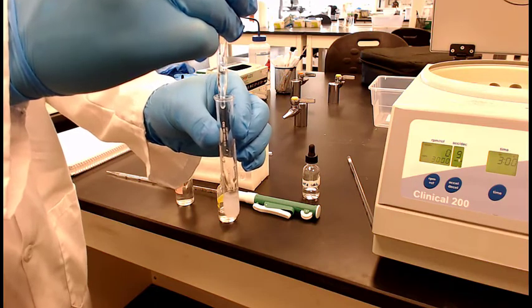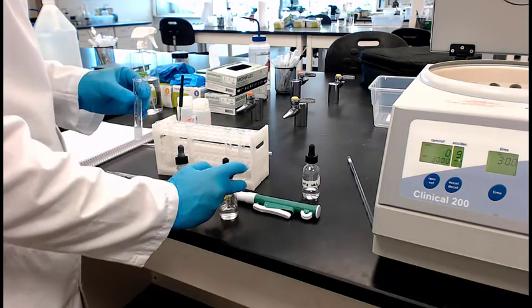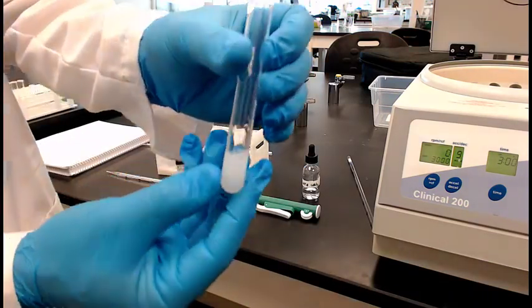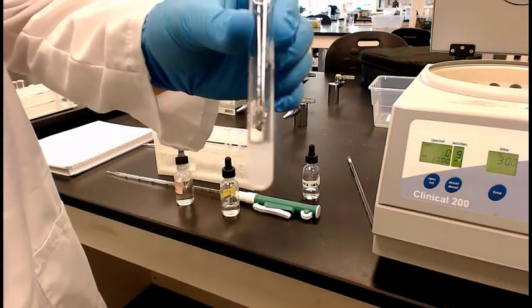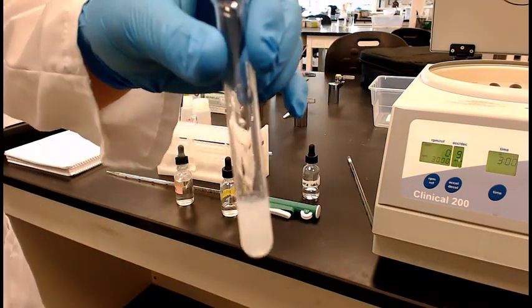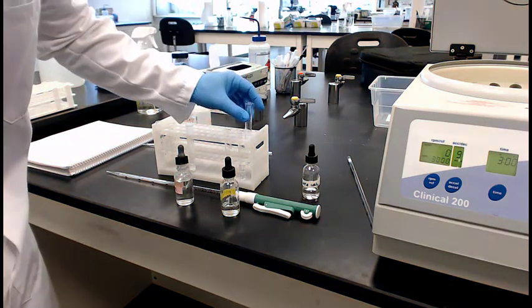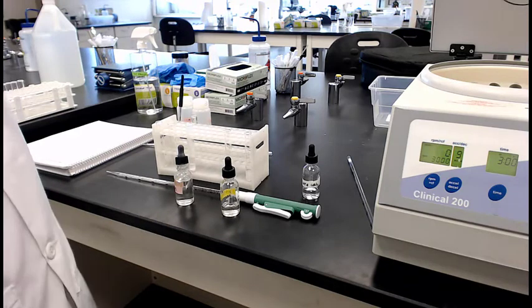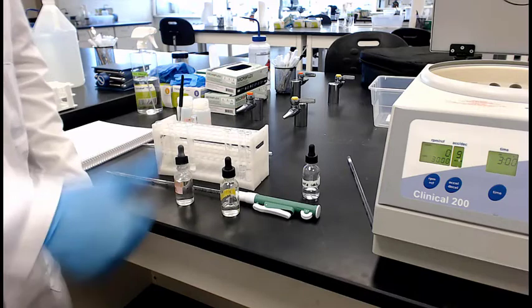Ooh, all right, so that's definitely precipitating up. Get it mixed so we can really see it. Yeah, that's good for you. That's one of the observations I wanted you to see. So you had the clear filtrate, then we added more of the sodium carbonate. It was able to push the reaction a little bit more. So that finishes step 6. All right.